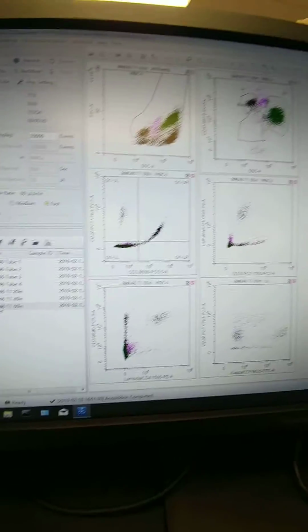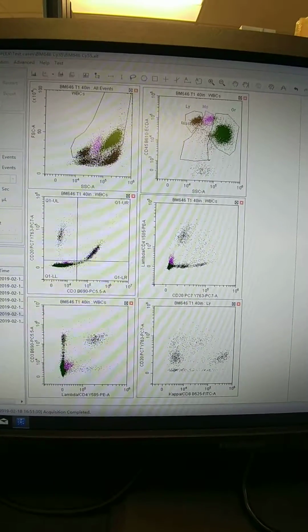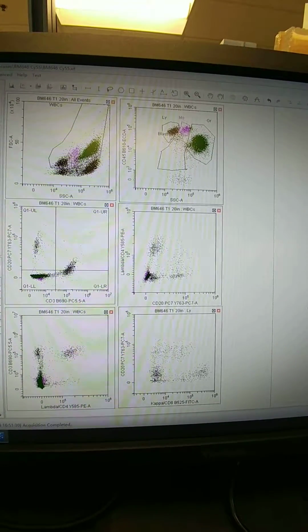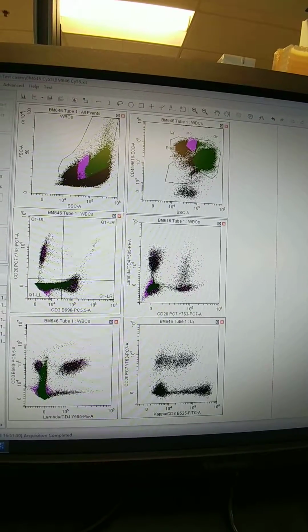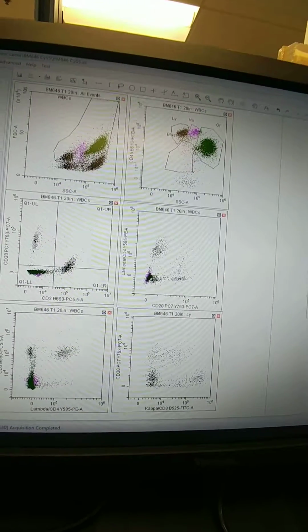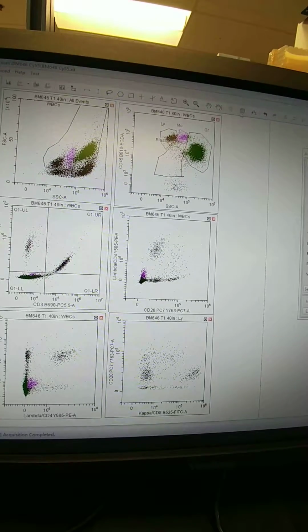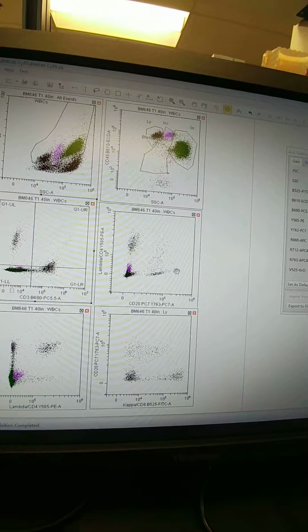Alright, do I see any difference looking? Let's see, this was the last one we did. The one before that. The one before that. And the original. So slight differences looking at it right now, but we'll look at it when we analyze and see what the difference is, and see if we find one that Steve likes a little better.